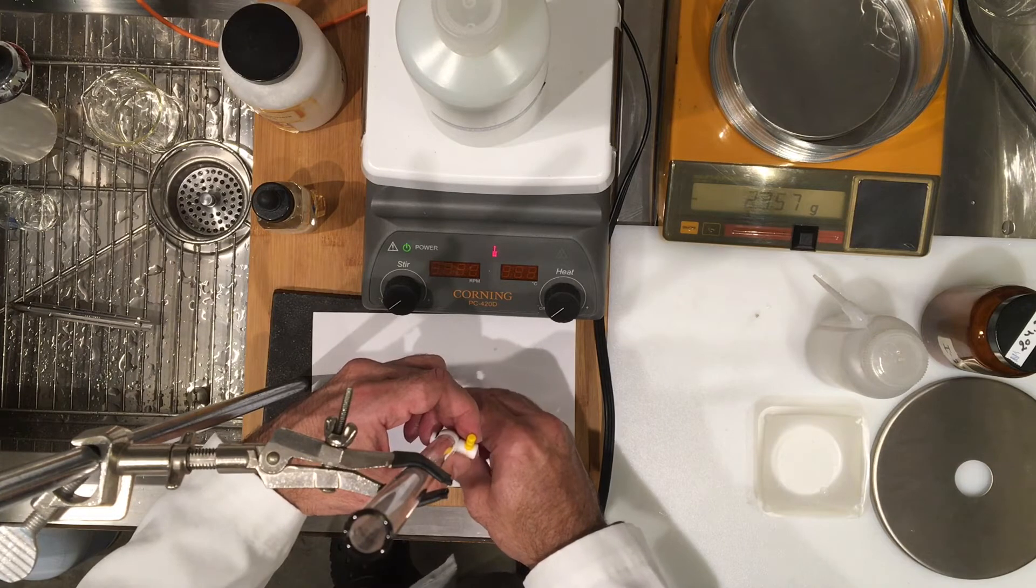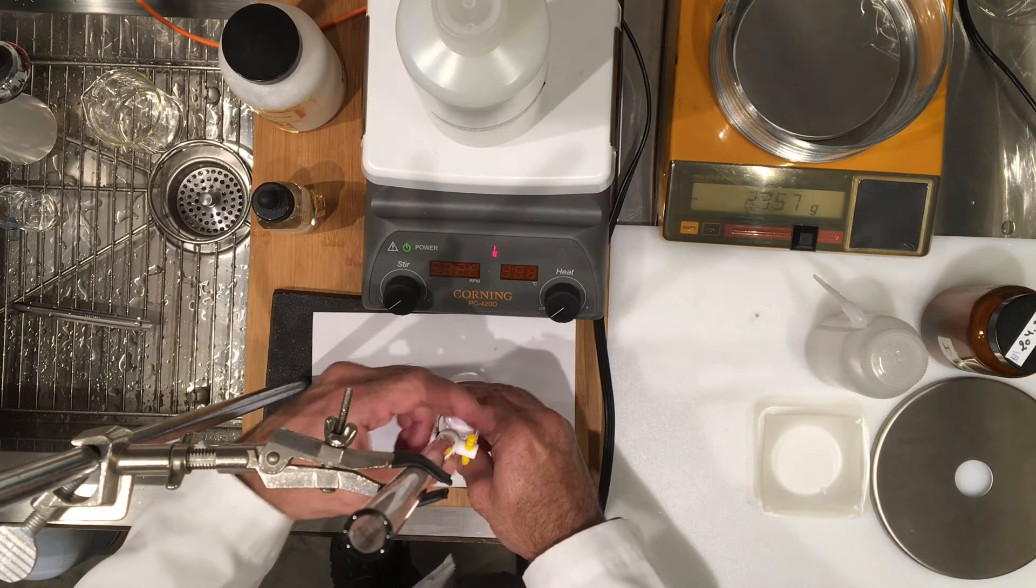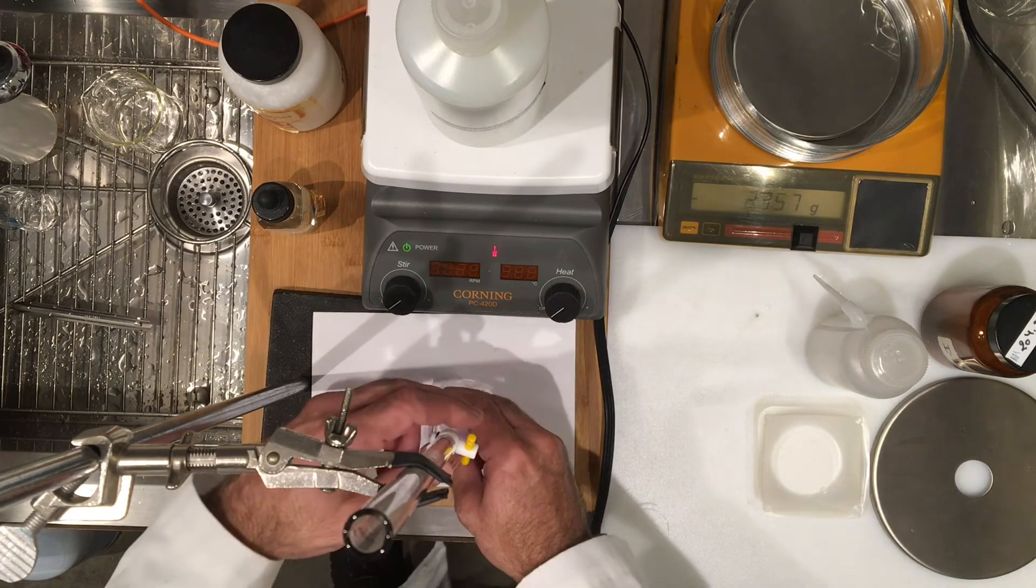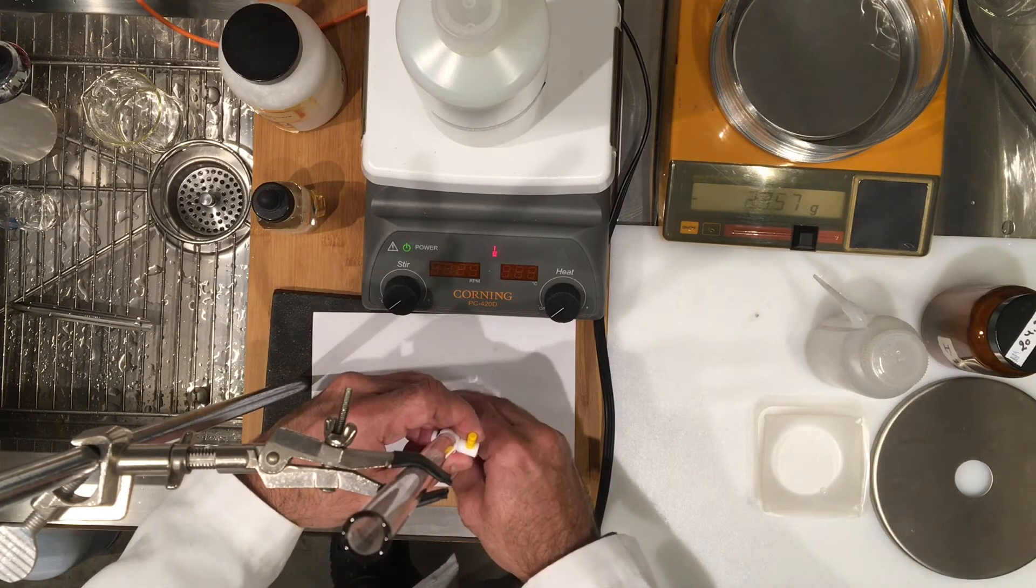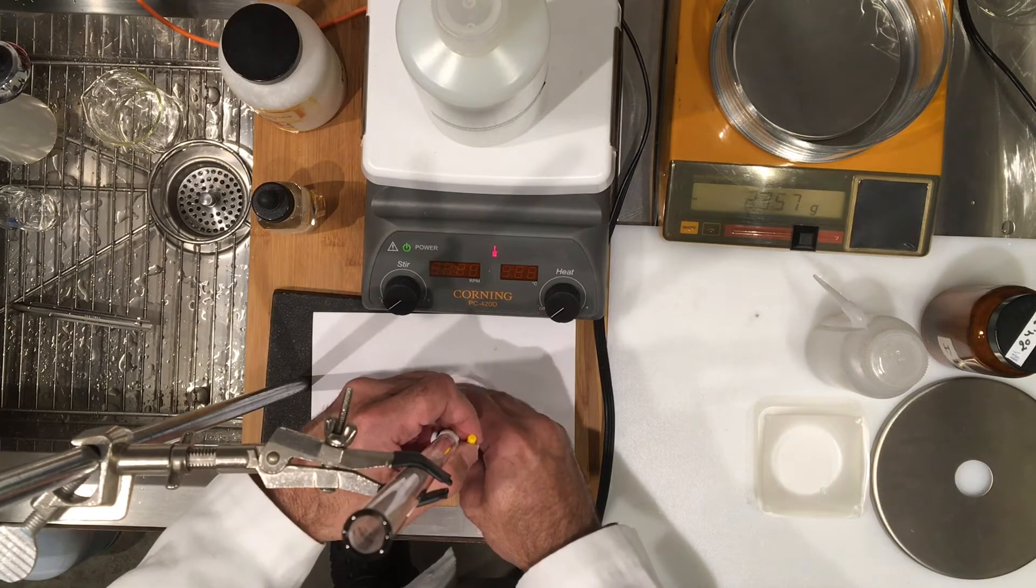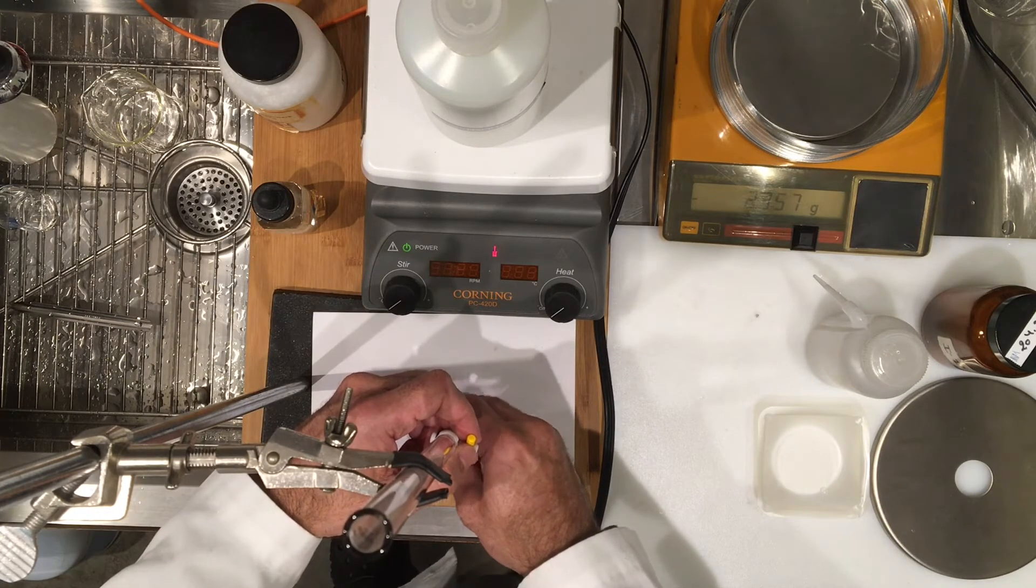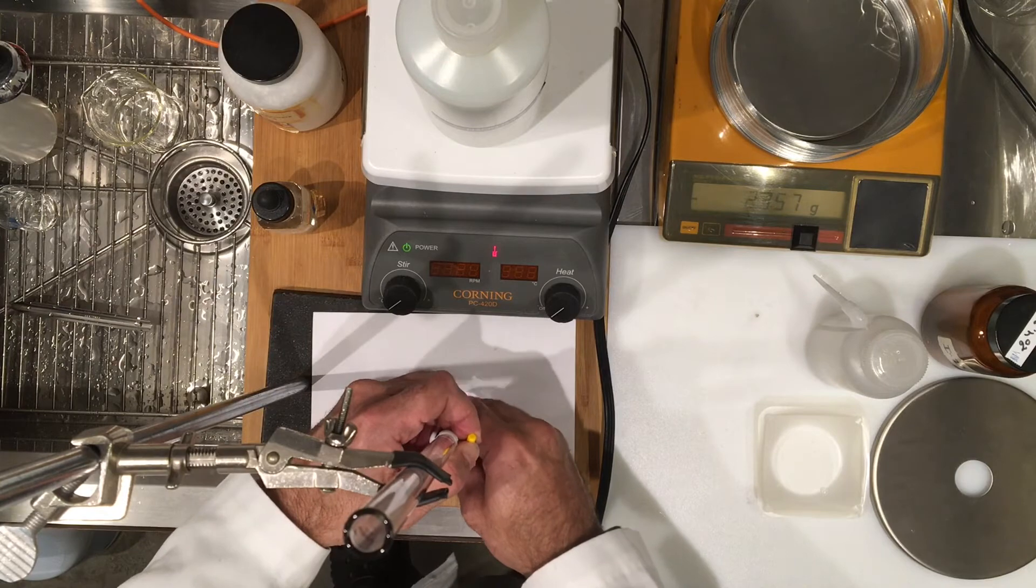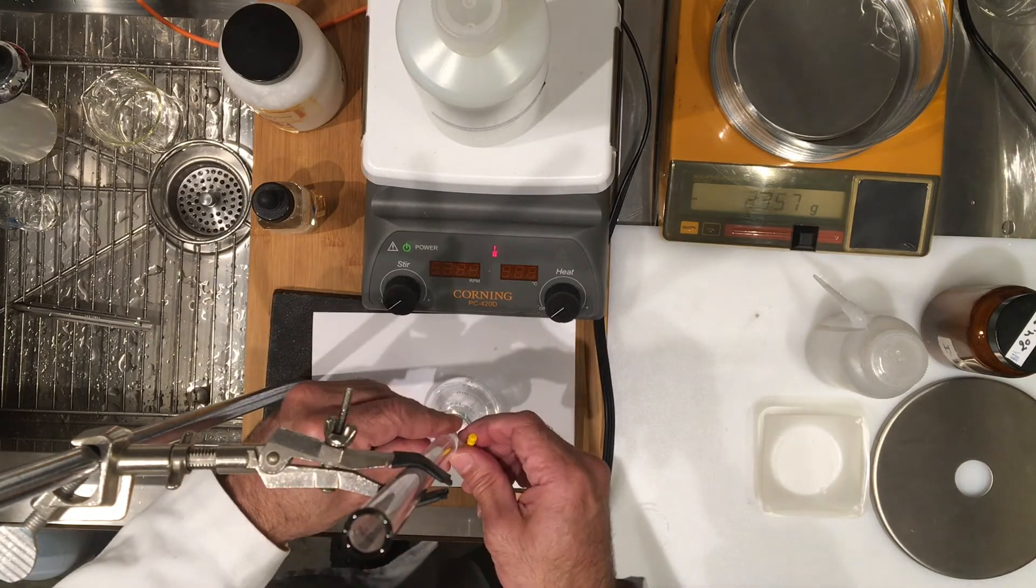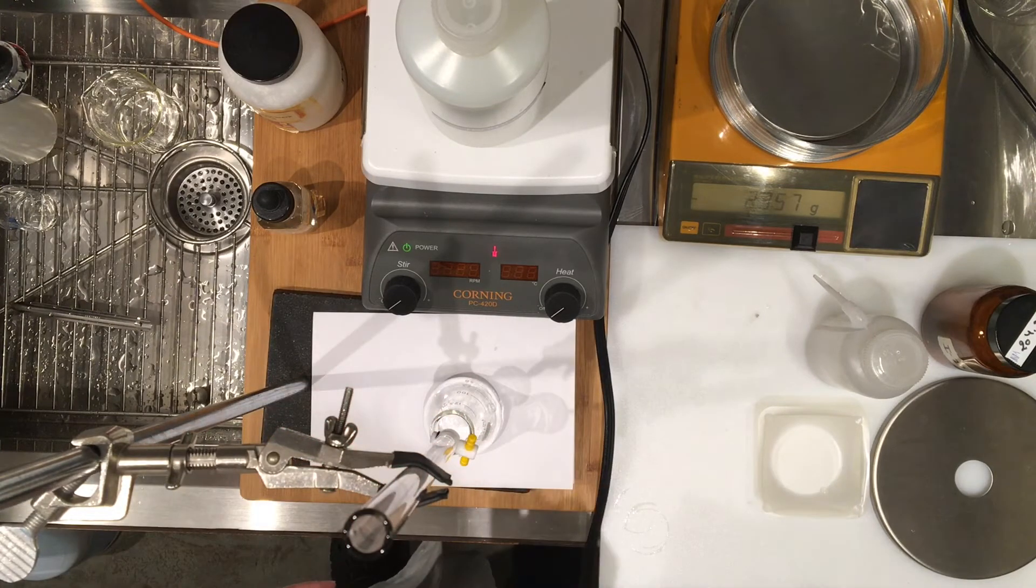I'm using one hand to mix and one hand to add drop by drop. You can see the color change now, it's more pronounced, so I'll be a little bit more careful.